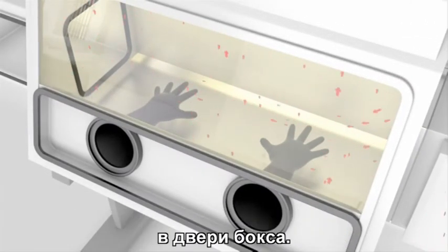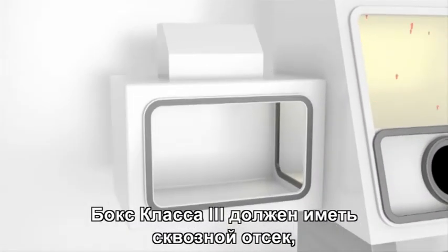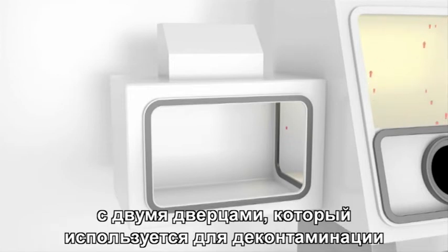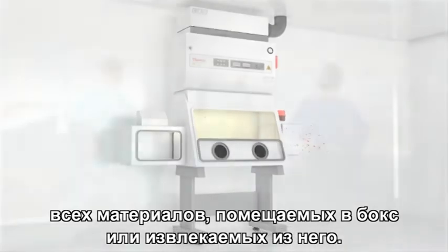Access to the work surface is by means of heavy-duty rubber gloves attached to ports in the cabinet door. The Class 3 cabinet has a pass-through box attached that can be sterilised and equipped with a HEPA filtered exhaust, or a double-door autoclave can be connected for the decontamination of all materials entering or exiting the cabinet.